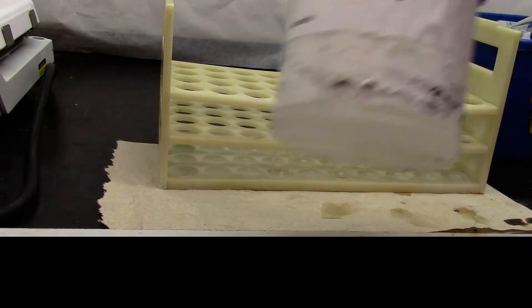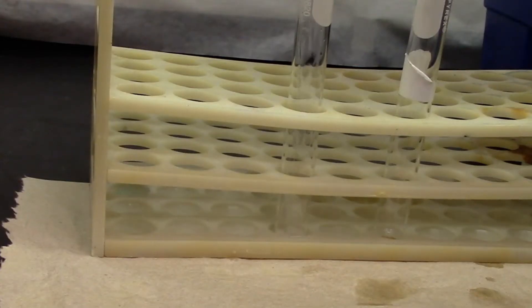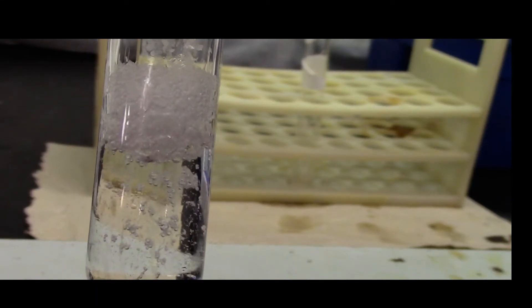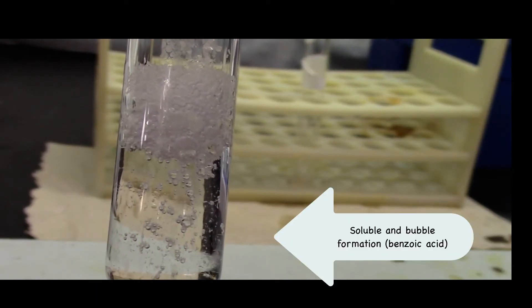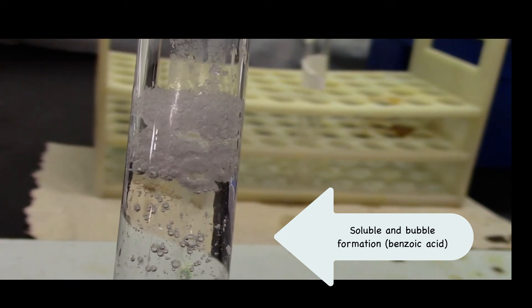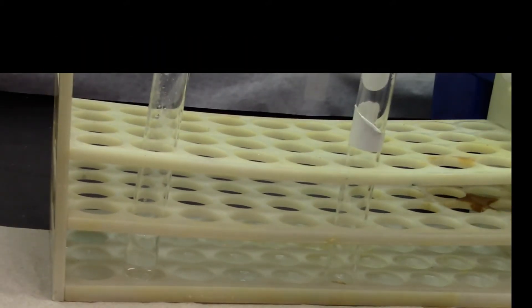We will be adding 5% sodium bicarbonate to each of these. You can clearly see this gas evolution. We will do the same with the beta-naphthol.